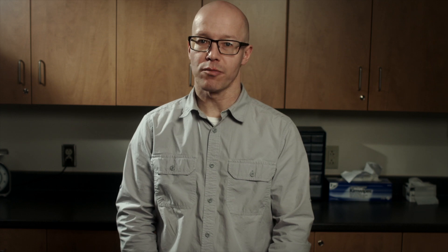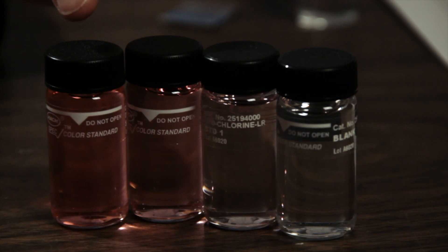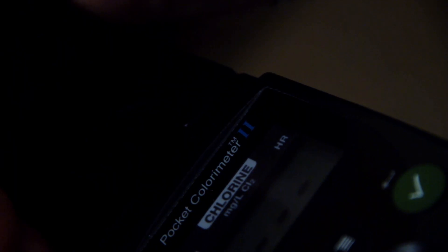The presence of a free or total chlorine residual will be indicated by a color change in the water sample. The water sample will turn pink if a chlorine residual is detected. The amount of free or total chlorine will be determined by the intensity of the pink color that is present. This unit measures chlorine residuals by shining a light through the sample bottle. The darker the pink color of the sample, the harder for light to shine through and the higher the chlorine residual. Therefore, anything else that may be on or in the bottle that could block light could interfere with the test. Make sure your sample bottle is clean with no stains, scratches, lint, or moisture in the bottle. Also ensure there are no air bubbles in the water sample.